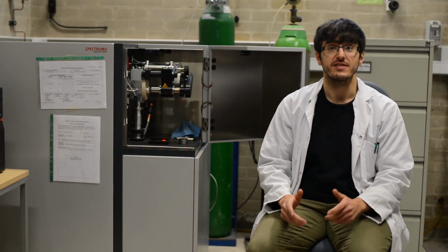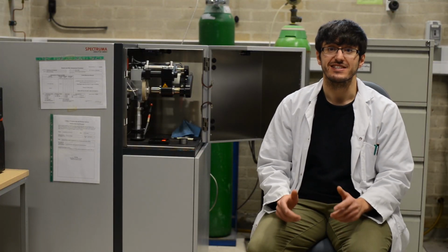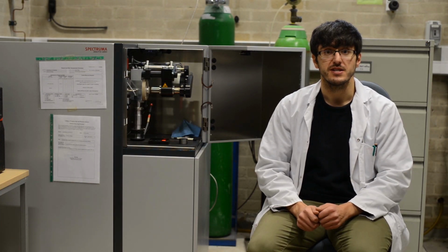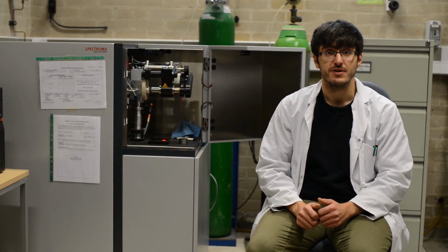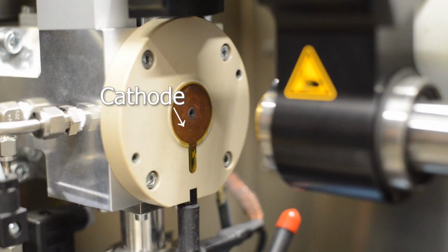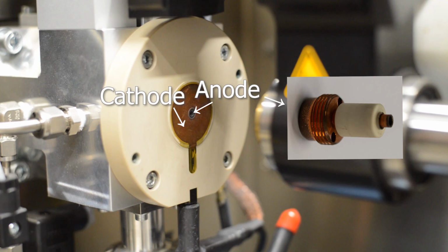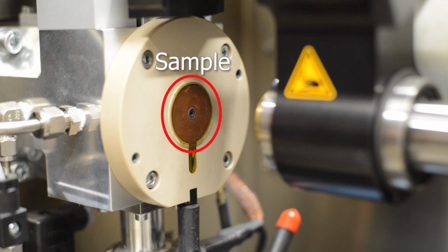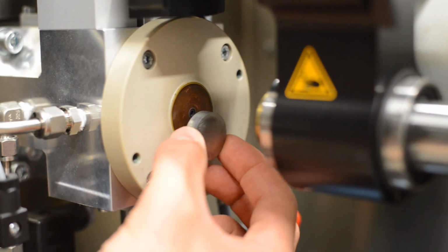The plasma used in this machine is a glow discharge and is the same as the plasma discussed in video 1 of this series. To form this type of plasma, it is necessary to have an anode, a cathode, and a low pressure. In this GDS, the cathode, which is this copper plate, and the anode, which is this internal hollow rod, are isolated from one another by a ceramic sheath. Samples are placed here and therefore are in direct contact with the cathode and subjected to a cathodic potential.